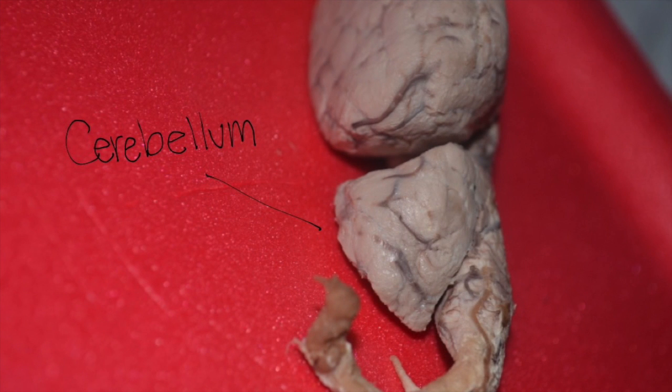The cerebellum, or little brain, is located just above the brainstem. Notice how folded and lumpy this part of the brain is. The folding increases the amount of surface area. The nerve cells occur in outer layers, and folding allows for more nerve cells to fit into a space. The cerebellum is the area of the brain that controls muscles and coordinates movement.